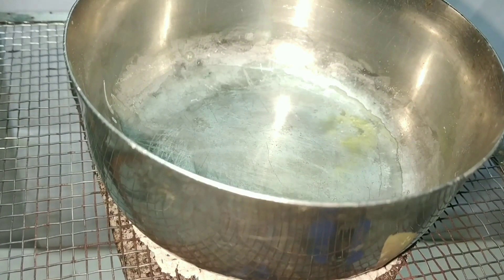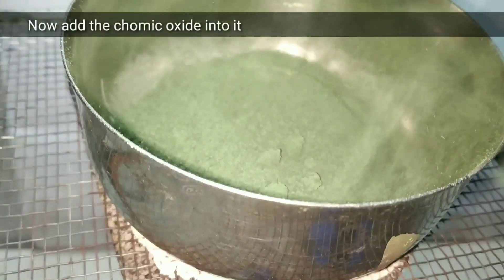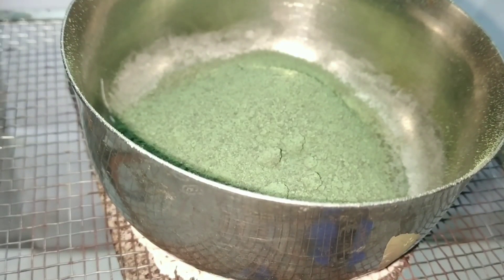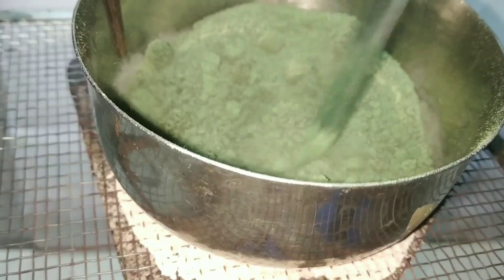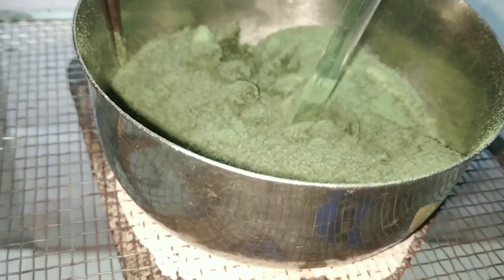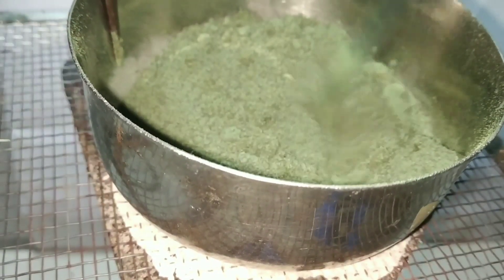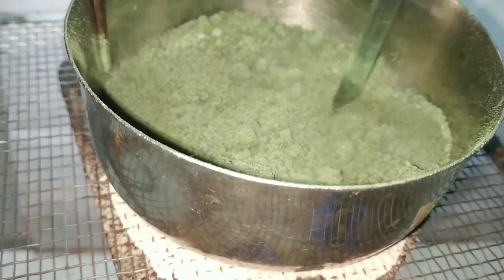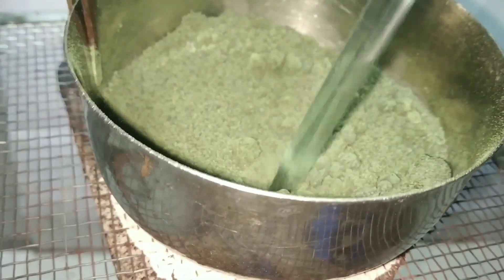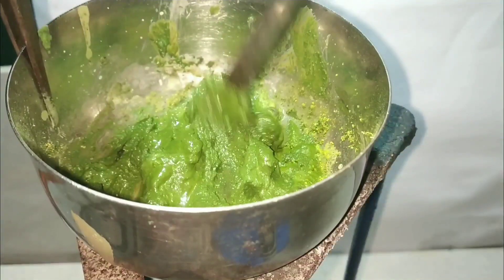Once it is a uniform liquid, transfer the chromic oxide into it and mix well with the molten potassium hydroxide. I had to add 4 grams more of potassium hydroxide because I felt the chromic oxide was not getting properly mixed. That is not a serious problem and it is not going to affect the end product.